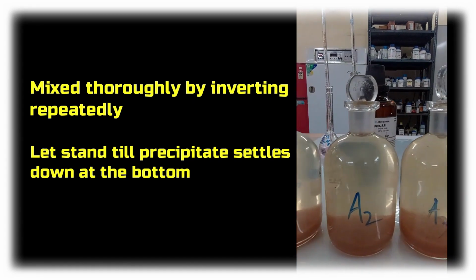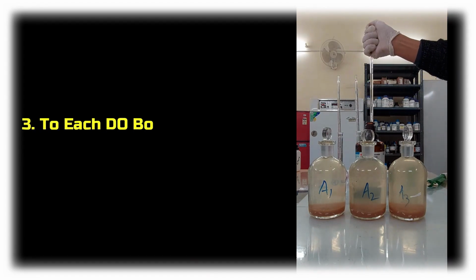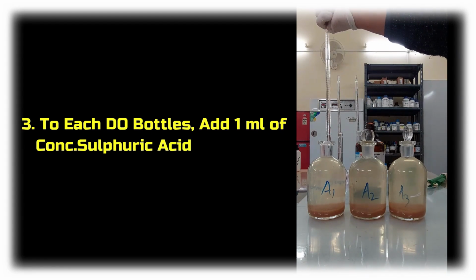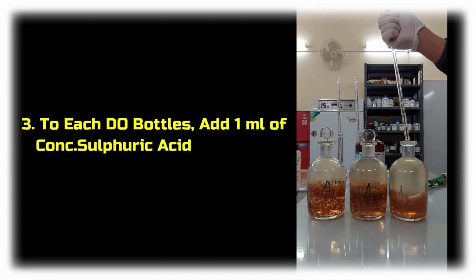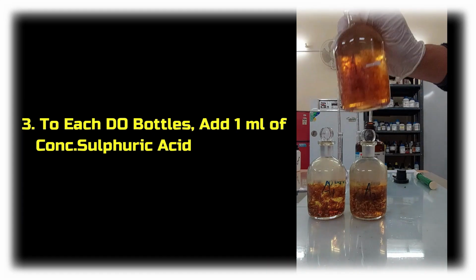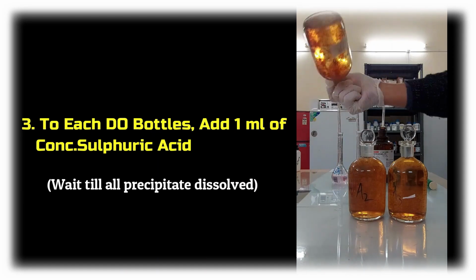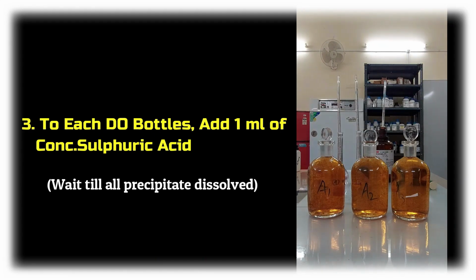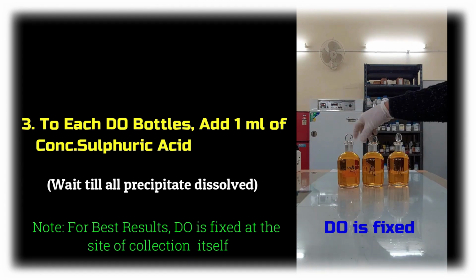You can see that the precipitate settles down at the bottom. Next, to each DO bottle, add 1 ml of concentrated sulfuric acid. After mixing thoroughly, you'll see that the precipitate starts to dissolve. After this, the dissolved oxygen in the samples is fixed.